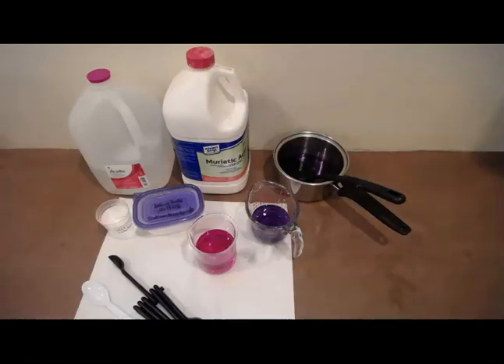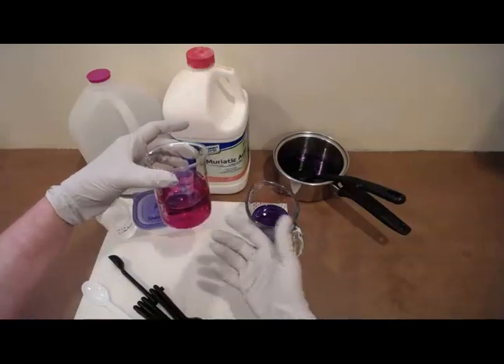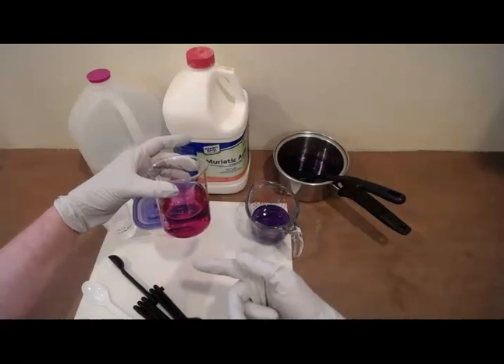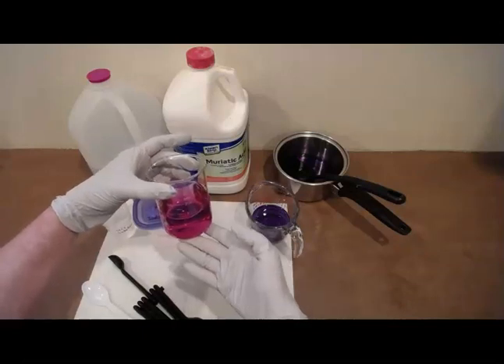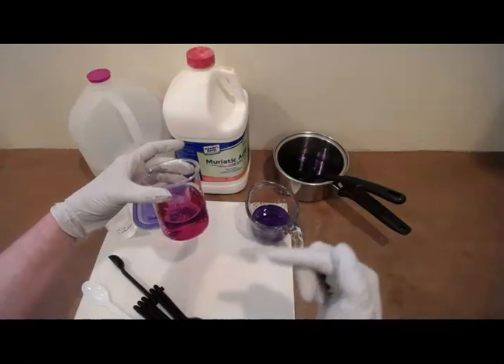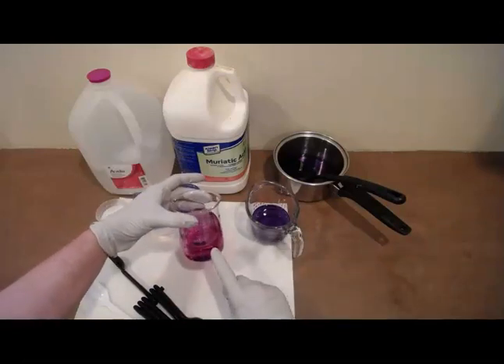Okay, so this experiment is causing us to observe what happens when the sodium bicarbonate from your pancreas is mixed with the stomach acid in the chyme that comes from your stomach. This part of the procedure is showing the acidic solution that is coming out of your stomach. So you've eaten, the food has been swallowed down the esophagus, it's been in your stomach where it has mixed with hydrochloric acid, and that mixture of food is called chyme. That is taken from the stomach into the upper small intestine, and this is where the pancreas makes sodium bicarbonate, and through a duct that sodium bicarbonate from the pancreas is going to come into the small intestine, where it will then encounter this acid chyme mixture.